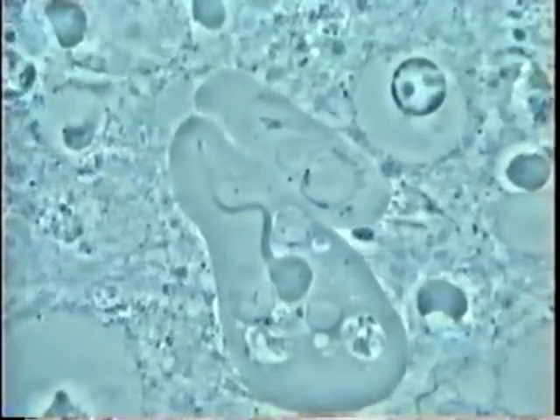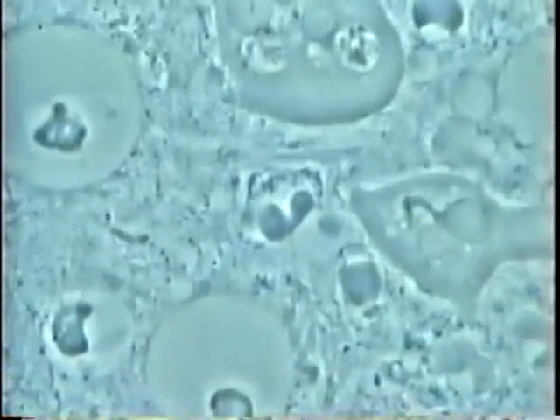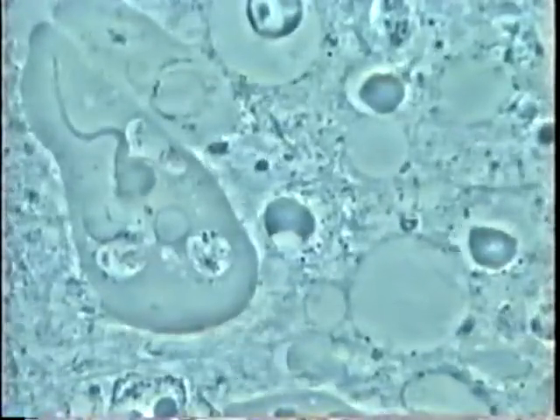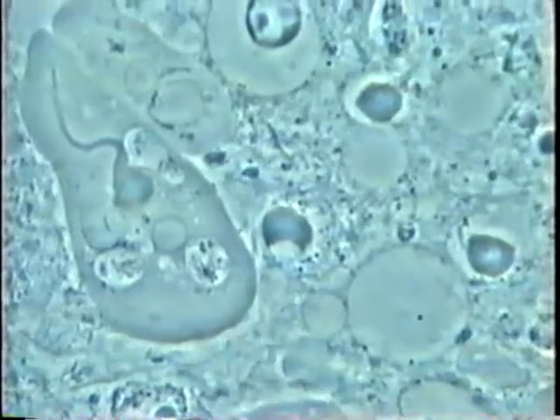We see very effective activity here: the amoeba in the center is finishing its phagocytosis of the nucleus, with a fairly smaller amoeba just beside and under it. See how much activity there is.